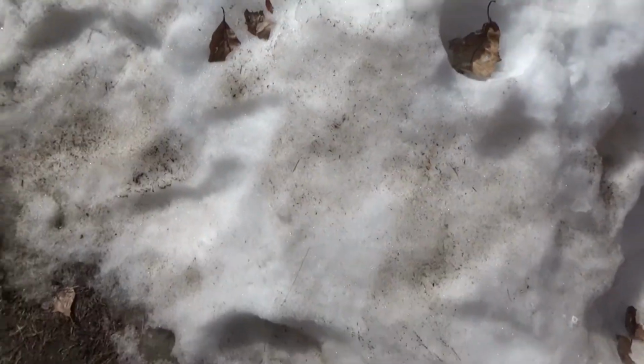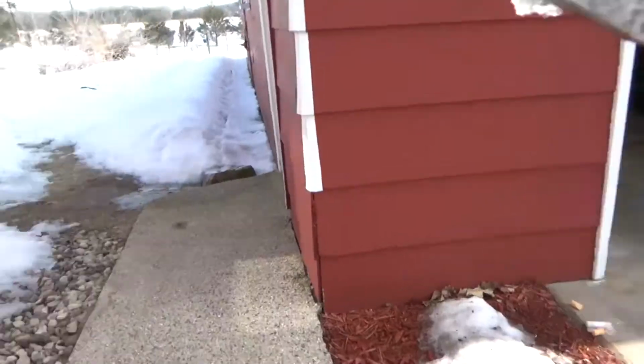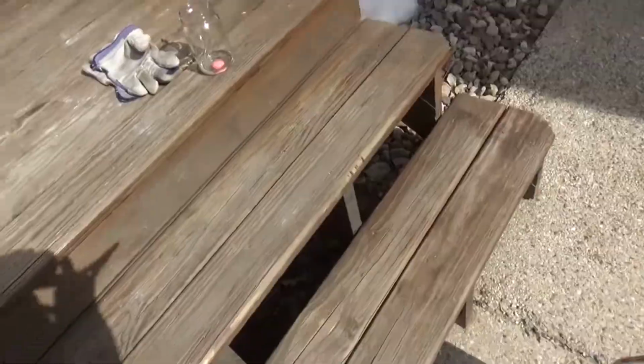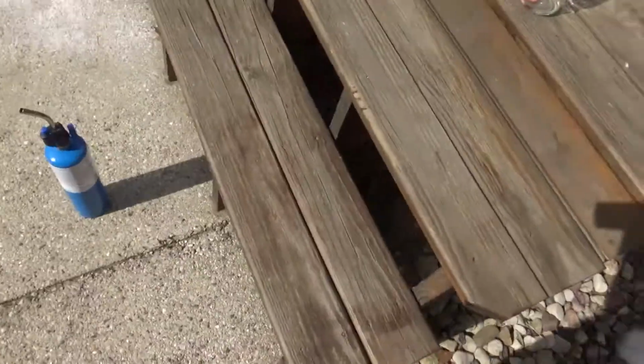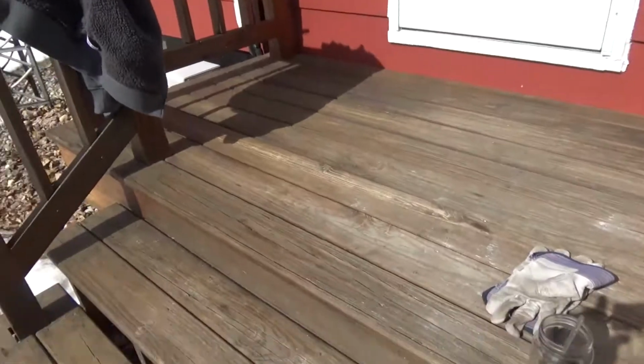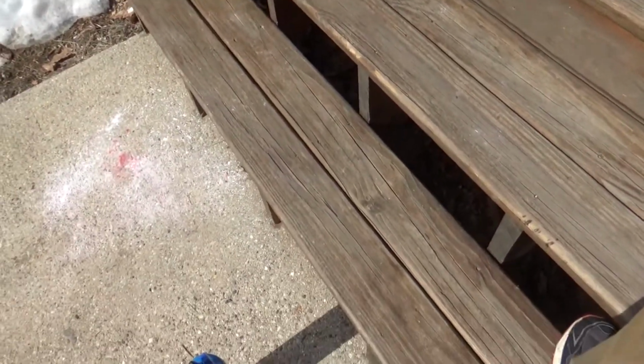So there you go. That's what happens when it gets caught on fire. It'll start to char up and then burn up after a while, obviously. You may think that's kind of obvious, but I just wanted to make sure. I wanted to make sure I wouldn't do anything crazy. But here is the one in the acid.